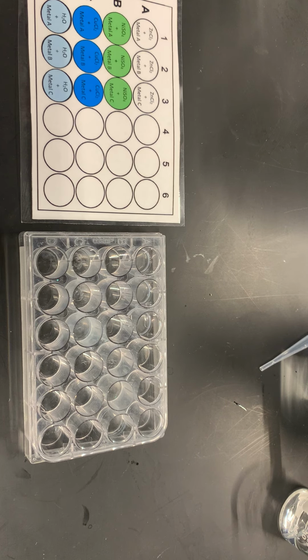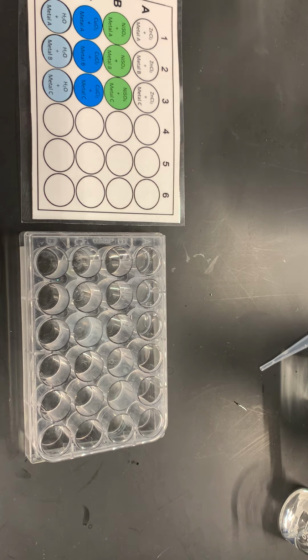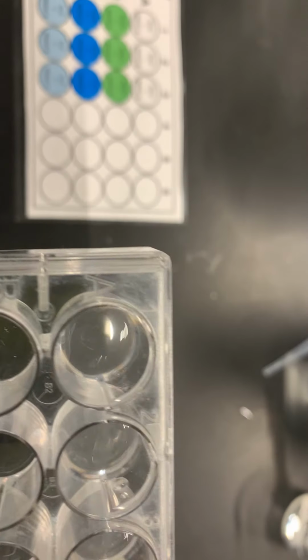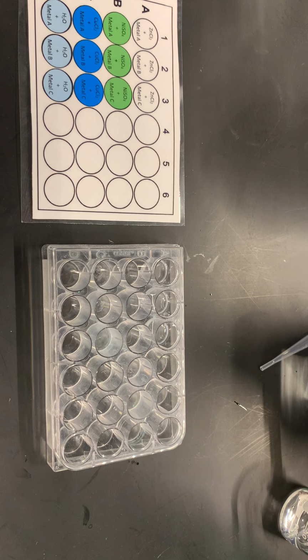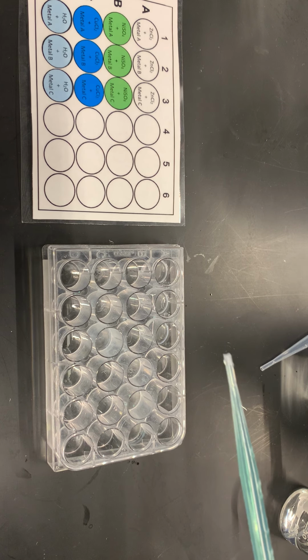So I have my first 3 solutions in these wells. Now, one thing that you'll notice about that zinc chloride solution, if I bring it a little bit closer, is it's kind of cloudy, kind of murky. It's worth noting anything about the solution itself before you add anything, so then you know whether or not the addition that you made had an influence on that solution.